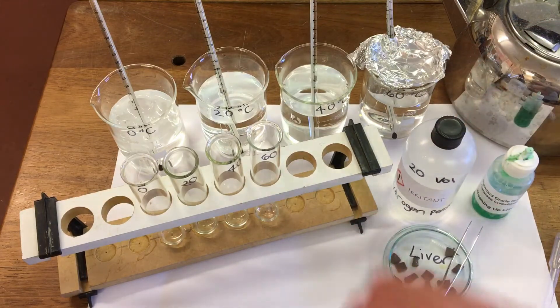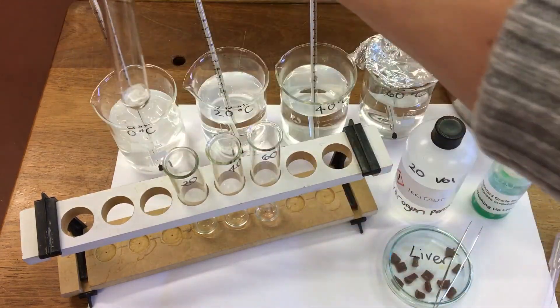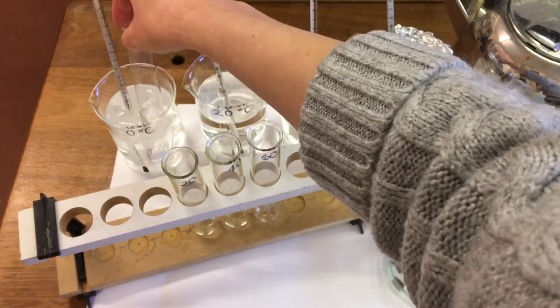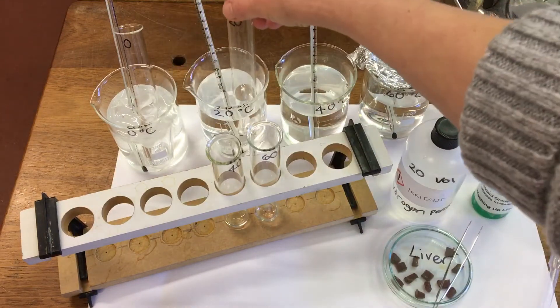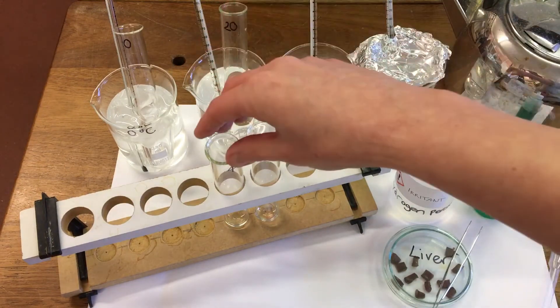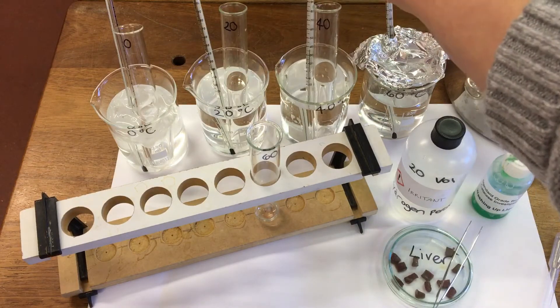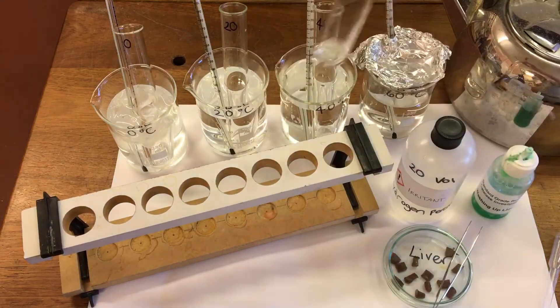Each tube is going to be placed at a different temperature. We've got zero degrees, 20 degrees, 40 degrees, and 60 degrees.